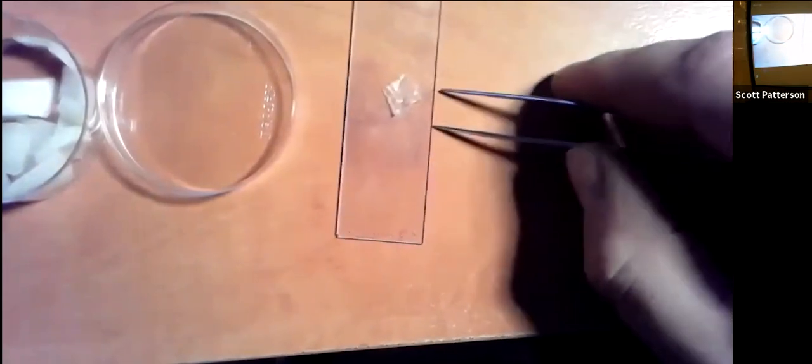Then, what color are these cells in here? See-through. How are we gonna see them? Yeah, you gotta stain them. This is called stain for a reason. Guess what happens if it gets on your hand? It'll stain your hands. Guess when it comes off? When that part of your skin comes off.